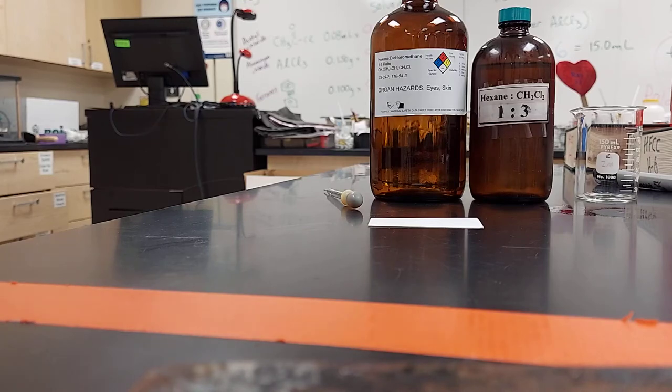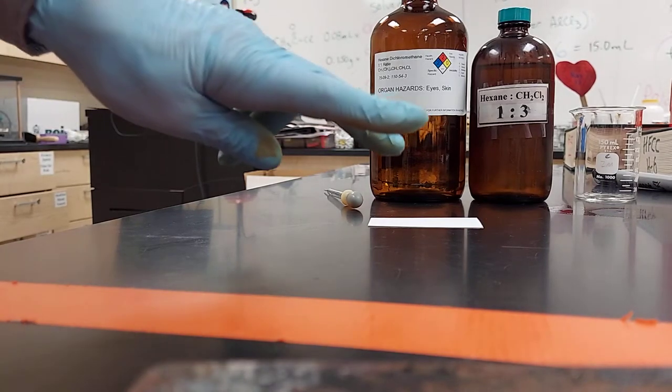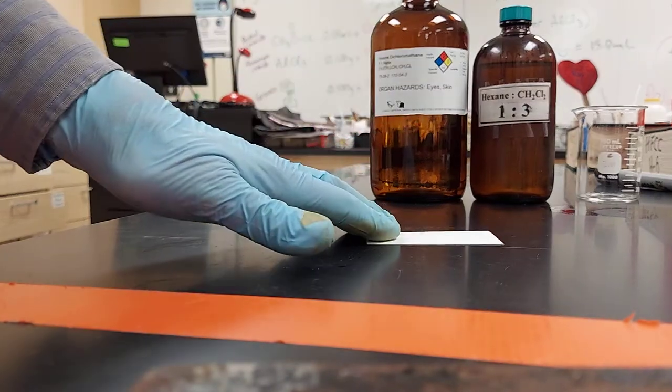Alright everybody, we're going to learn how to set up TLC plates for the final.